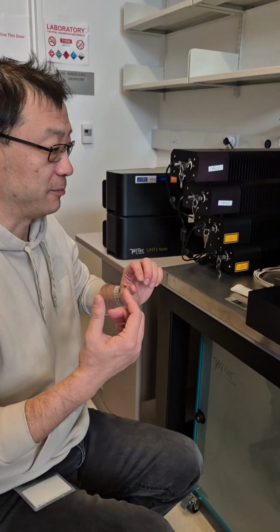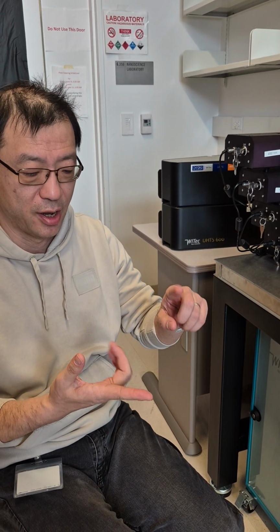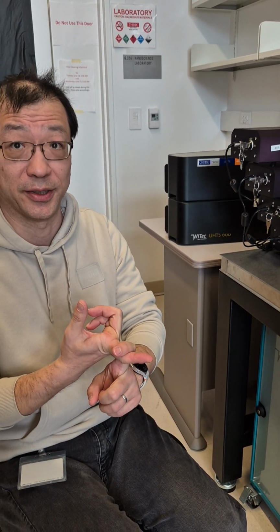Number 4, 100x lens, less than 0.5 millimeter. If you have anything like liquid, gel, powder, or non-even surface sample, you can only use number 1 and number 6, because number 1, the 10x lens, also has 9 or 10 millimeter working distance.